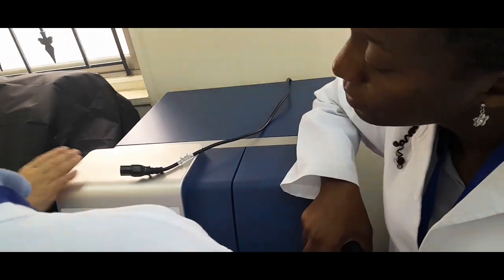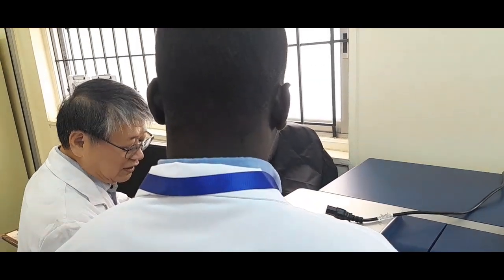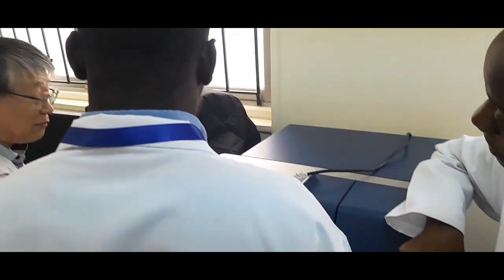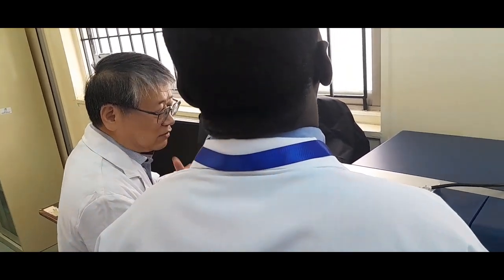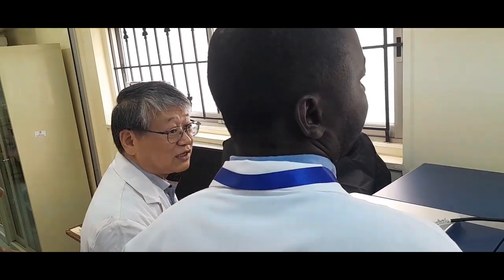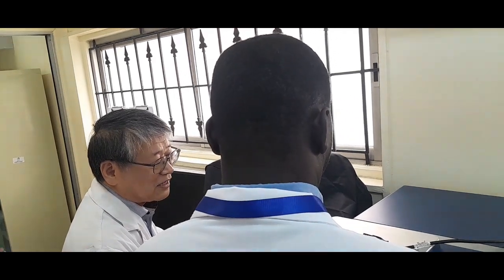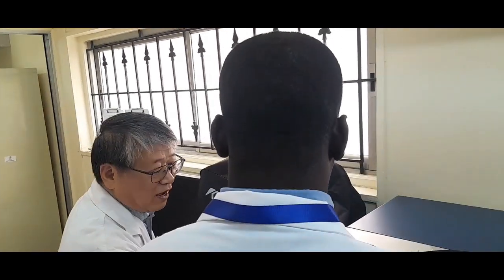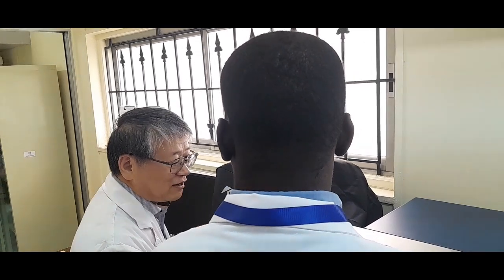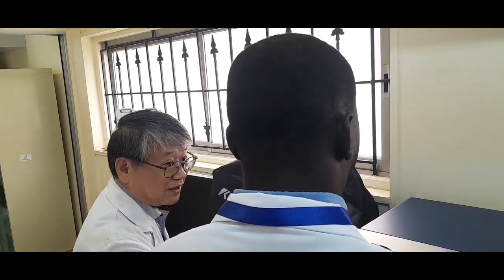Currently we mainly use it for the ELISA to read the absorbance of each well, but my team member sometimes uses the MTT assay to see how many percent of the cells are still alive or dead. So many kinds of purposes we can use this for. So multifunctional plate reader.